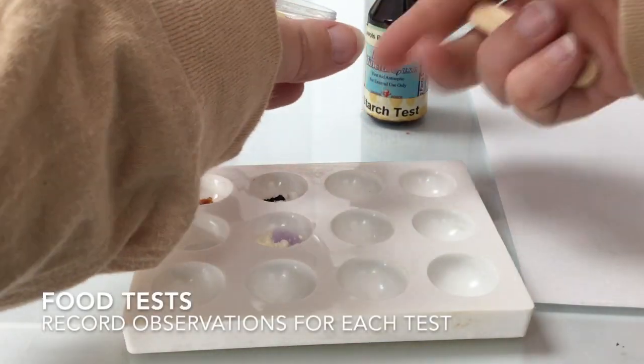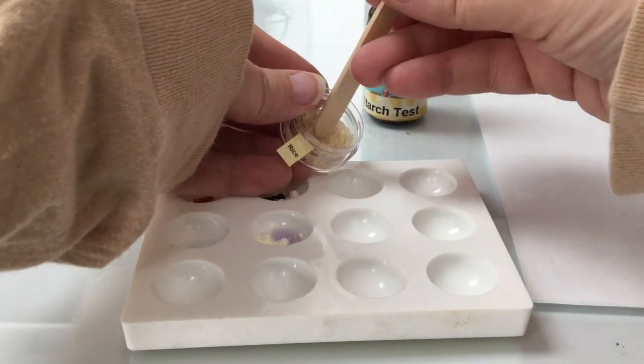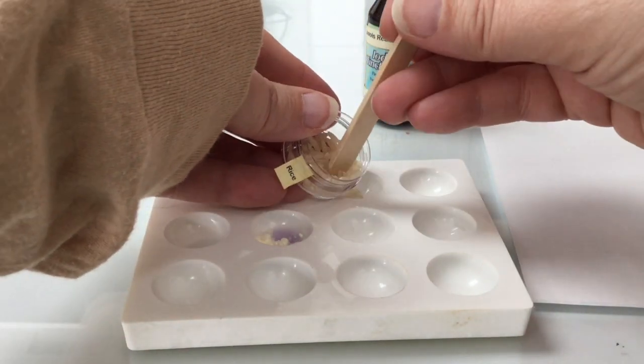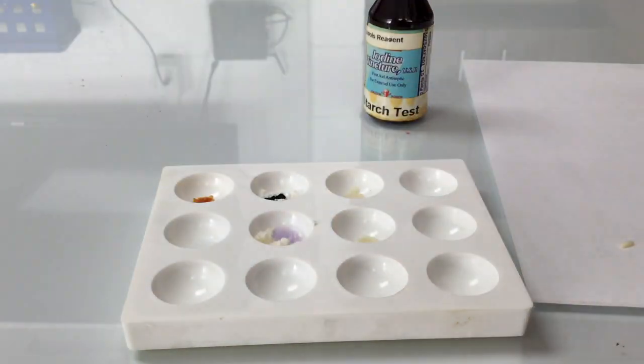Now that we know what the negative and positive tests look like, we're going to test some other foods, in this case rice, and we're going to test them for the protein and for the starch, and in some cases we will test them for the fat. So we have rice in both the starch and the protein columns.